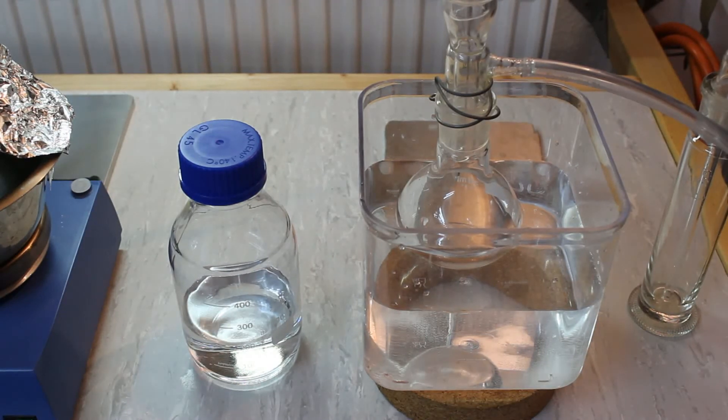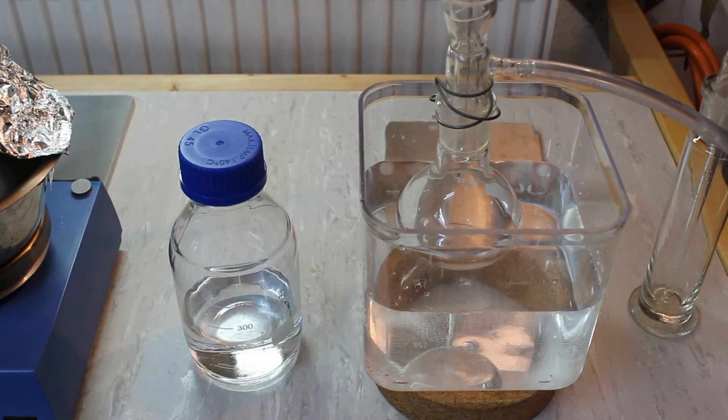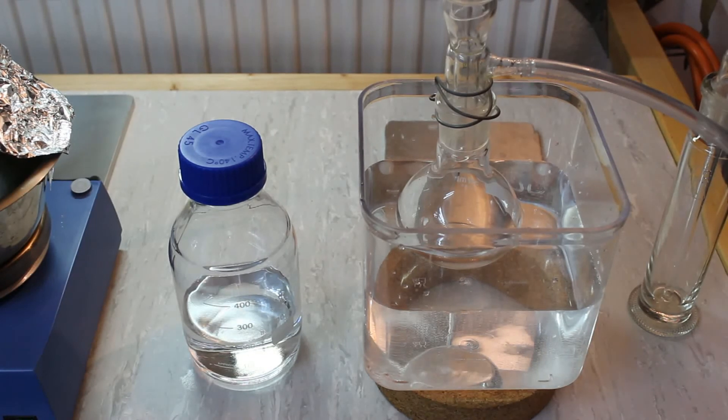The collecting flask was getting quite full so I took it off and poured all the ether I had so far into this bottle.